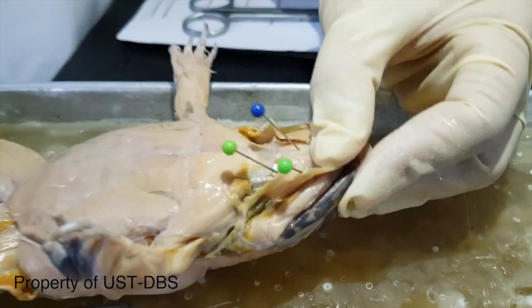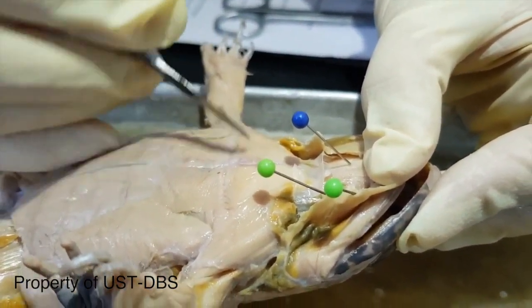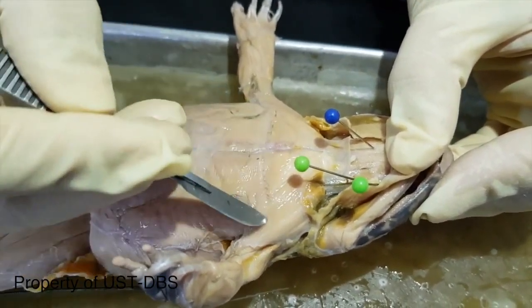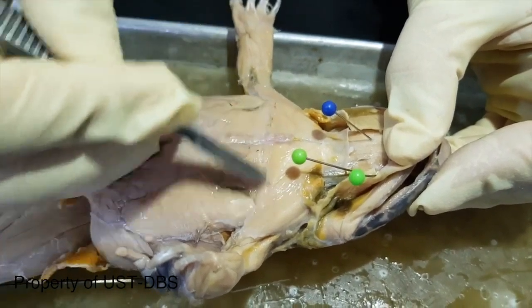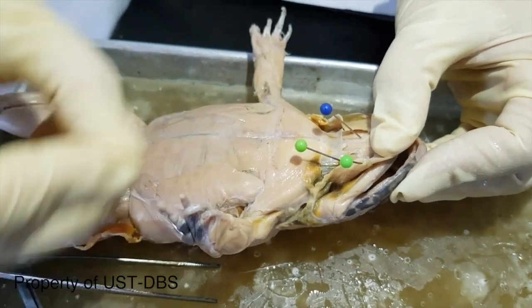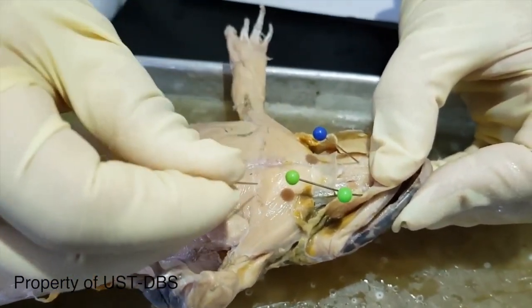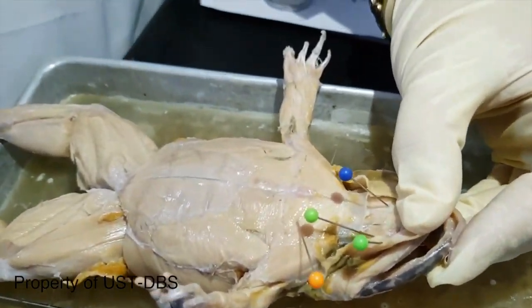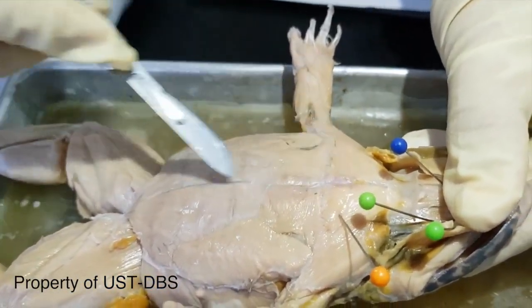As you go down, posterior caudal, this is the previously identified deltoid, and there's a muscle that runs from the radial side to the sternum, the sternoradialis. Okay, next are the pectoralis muscles. The pectoralis muscle runs downward.